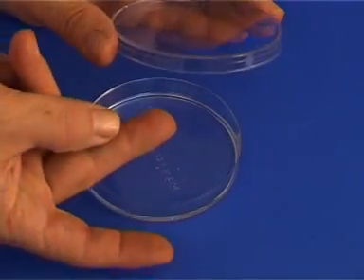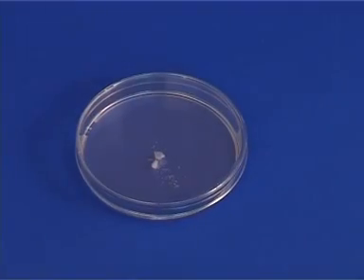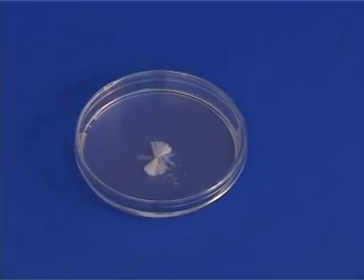Now put one tiny crystal of sodium acetate from the other vial in the solution. Observe what happens.